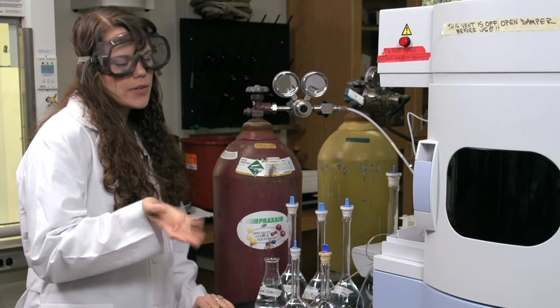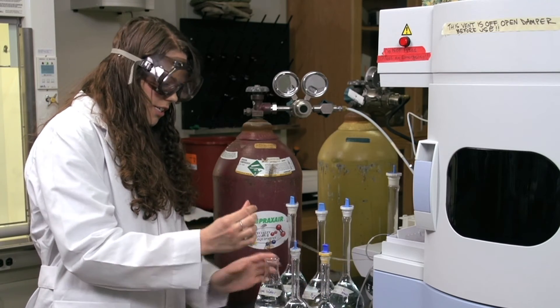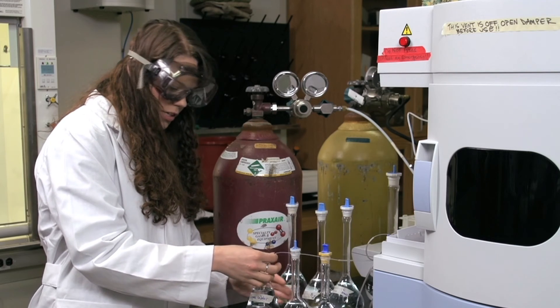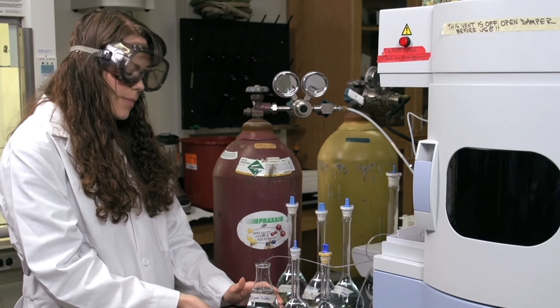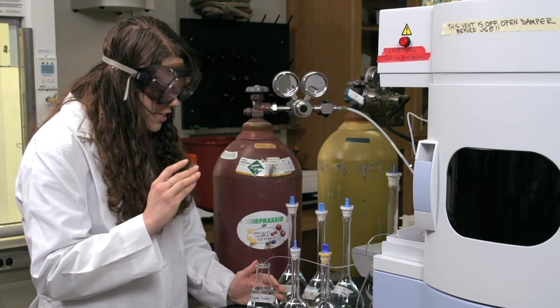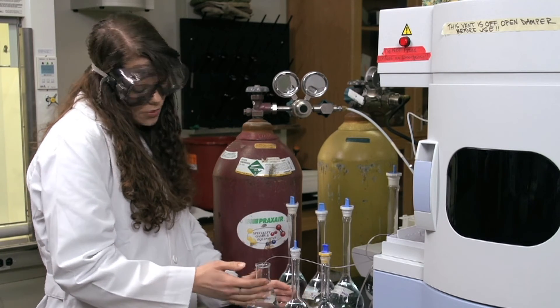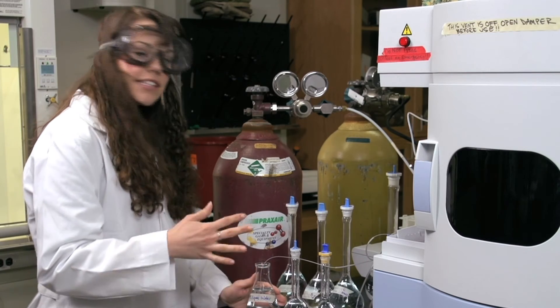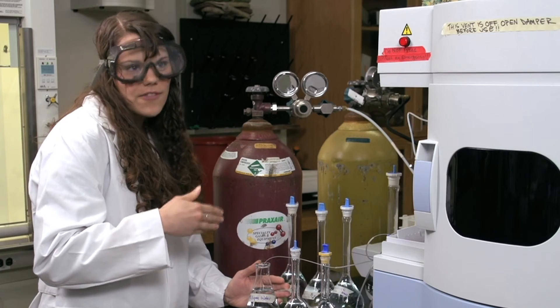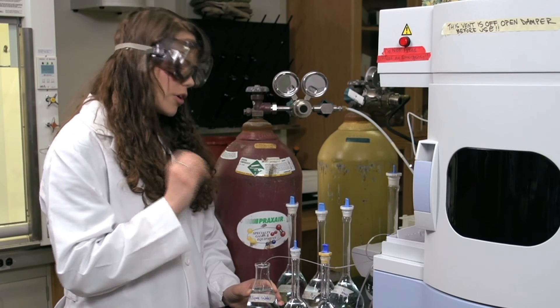Collecting a sample using the ICP-AES is straightforward. Insert the inlet line into your sample, making sure the plastic end is fully immersed. Use the millipore water throughout the experiment to rinse between different solutions. For example, going from solution A6 to solution D requires rinsing. However, if you are going from low to high concentration of the same solution — say A5 to A6 — you do not need to rinse with millipore water.